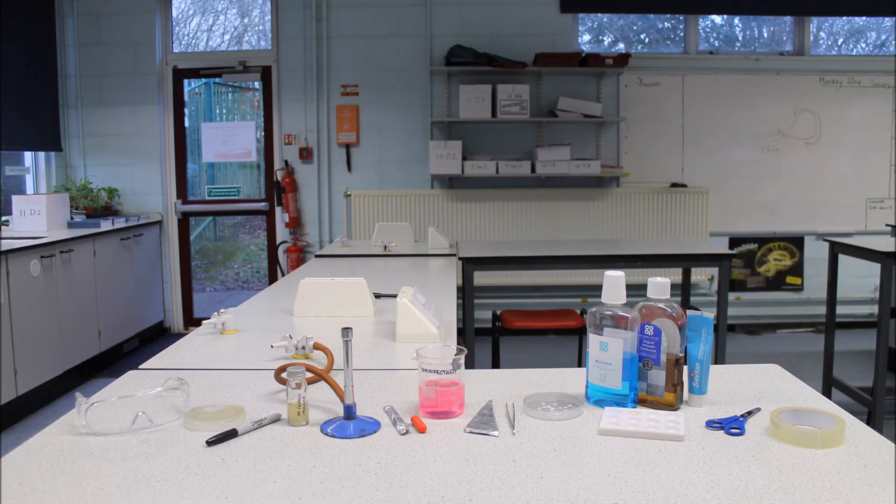For this GCSE Biology Required Practical, we will be investigating the effect of antiseptics on bacterial growth, and you will need the following equipment.